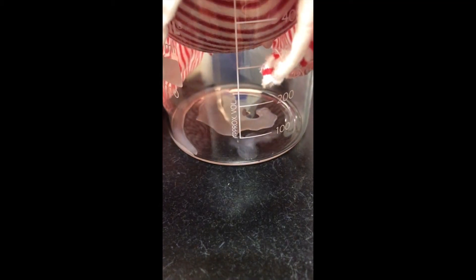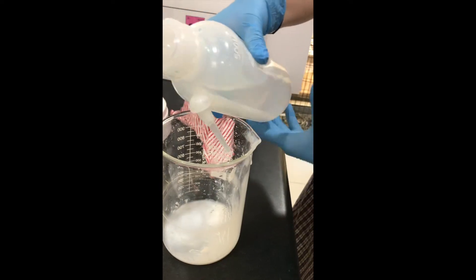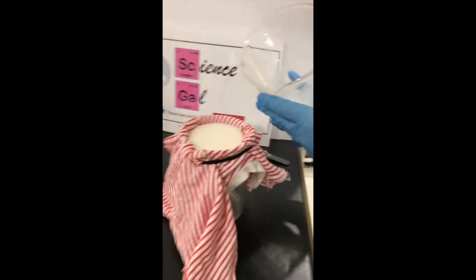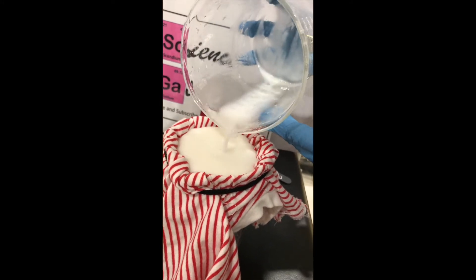This is a pretty slow process and will take overnight to filter. Ensuring that all the product is being collected, rinse the sides of the beaker then pour into the filter. Repeat this process as many times as needed.